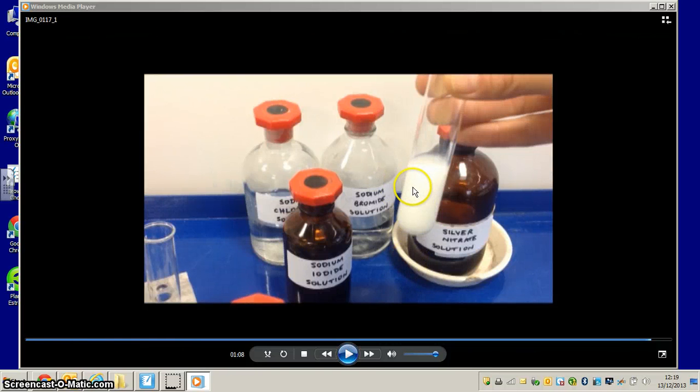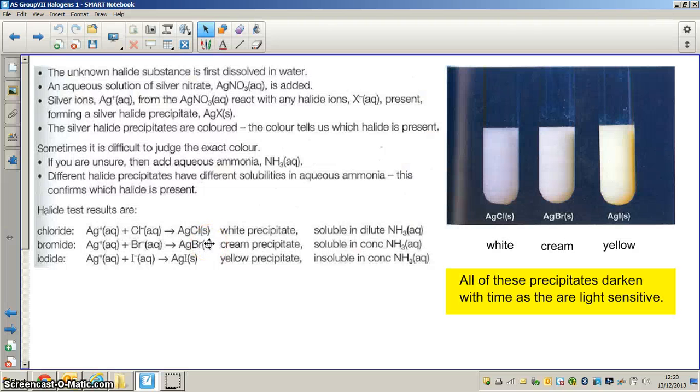So here again we have a distinguishing feature. With the sodium iodide we get the precipitate, but this time the precipitate remains when we add both dilute ammonia solution and concentrated ammonia solution. So let's summarise what we know. The test for a halide is the addition of silver nitrate solution to a solution of the halide.